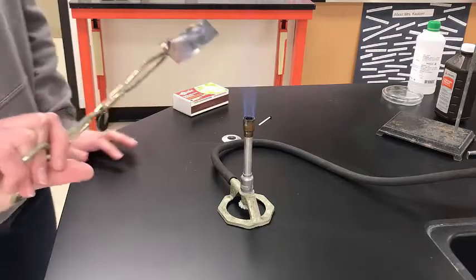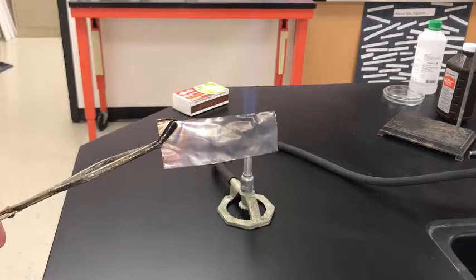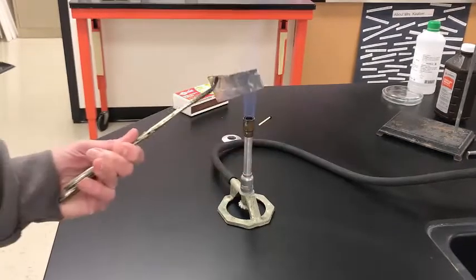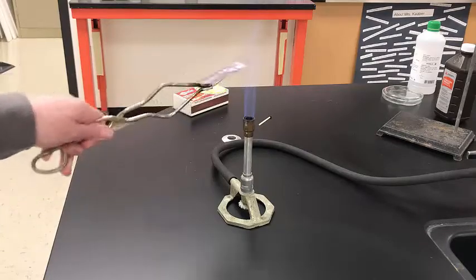have here, look at what happened to our copper metal after we heated it. You see how it looks now? Much different from what it looked like before. Okay, so you have some signs of chemical changes right there.